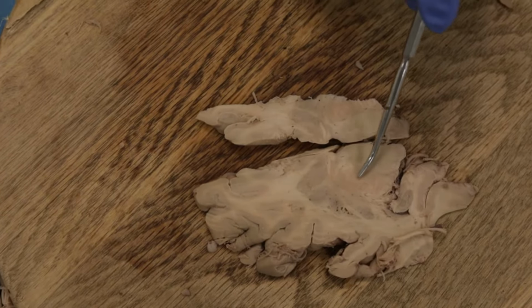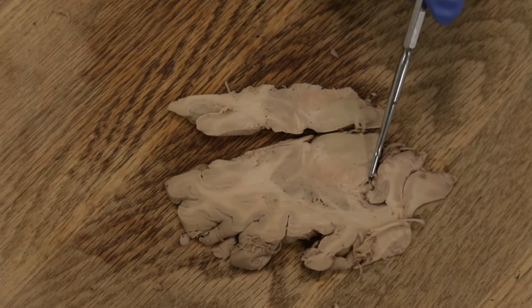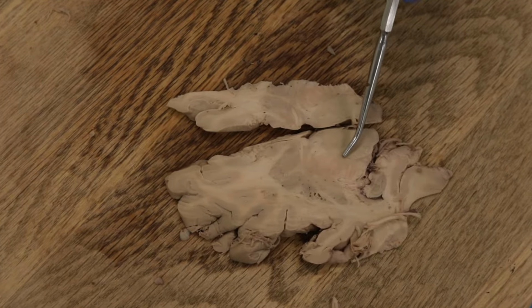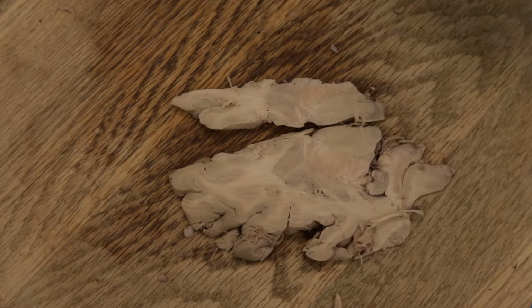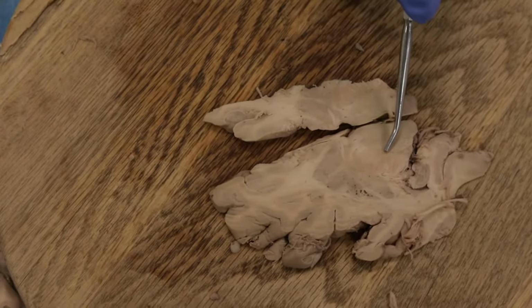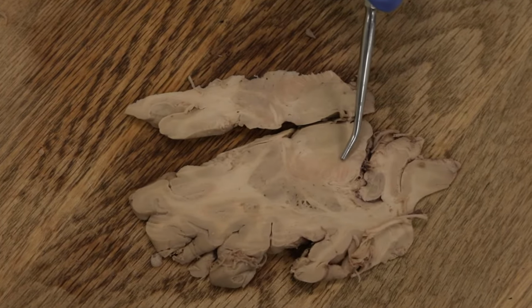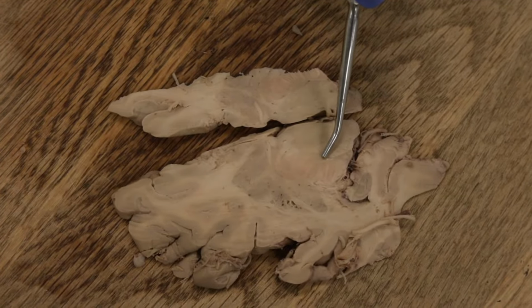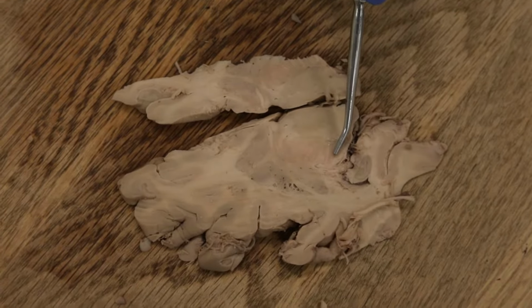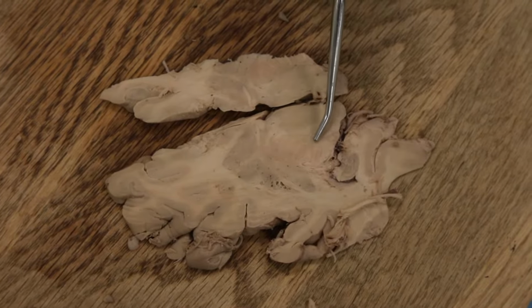It's hard to tell exactly where the posterior limb of the internal capsule ends and the cerebral peduncle begins, but I think it's cerebral peduncle because we're getting into right here the subthalamic nucleus. Now this will be larger here on our next section, but if you can see this, it's a little football-shaped nucleus right there. And this is where we begin to see it, right at that junction here between posterior limb of the internal capsule and cerebral peduncle. And it's kind of medial right here.